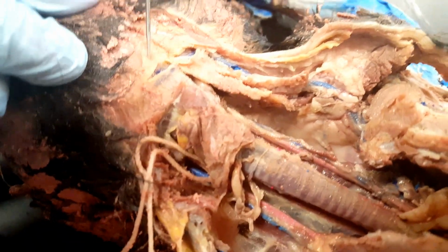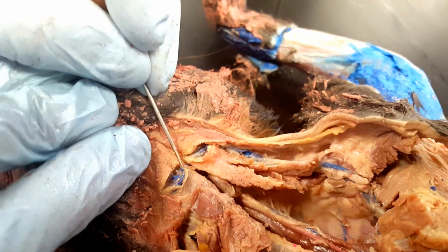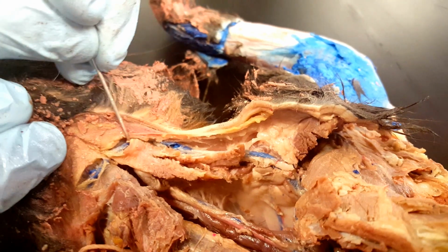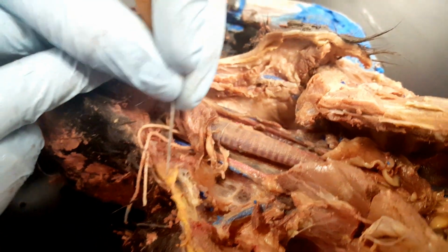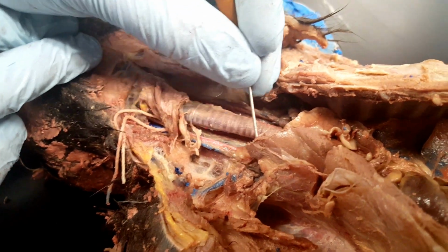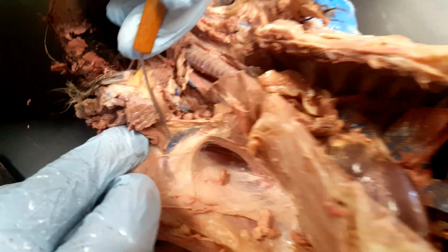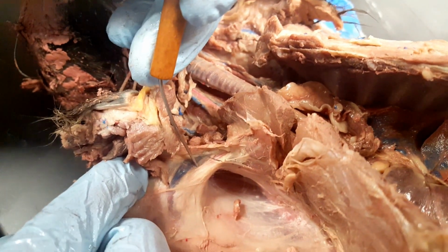And those two external jugulars will come up, and they're going to meet in the middle here with the transverse jugular, which you can see in blue. So if you follow them, the external jugular is going to come up, cross over, transverse, meet back with the other external jugular, and then it's going to go back. You can also follow, here is the brachial vein in blue, and next to it, but maybe a little hard to see, is the brachial artery.